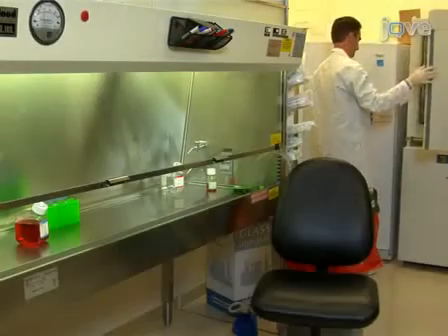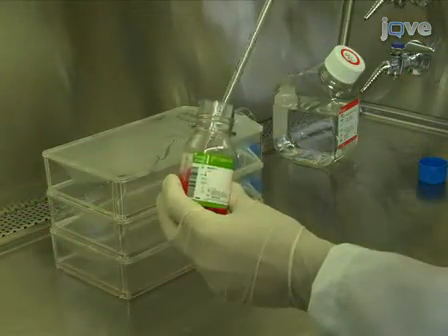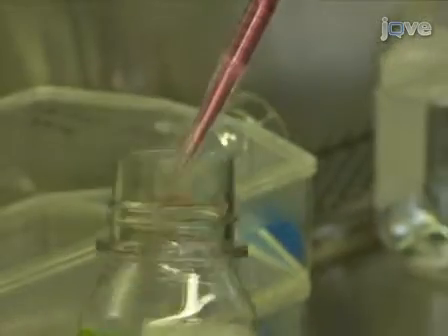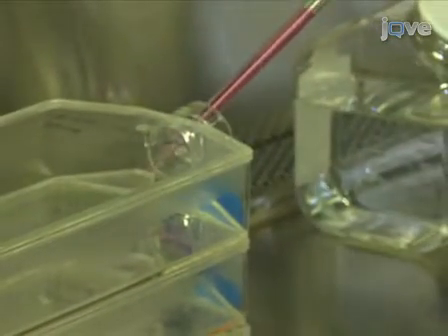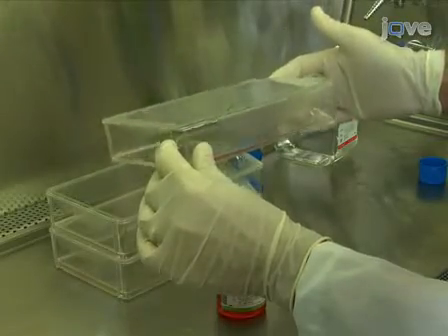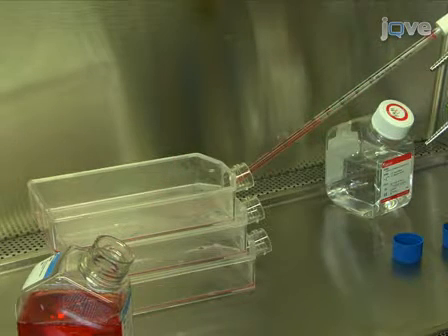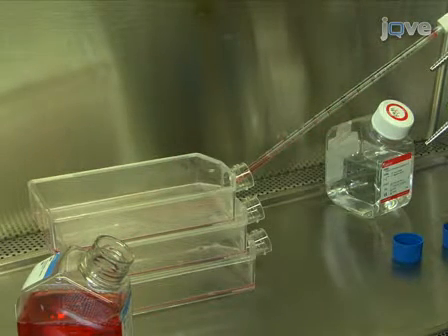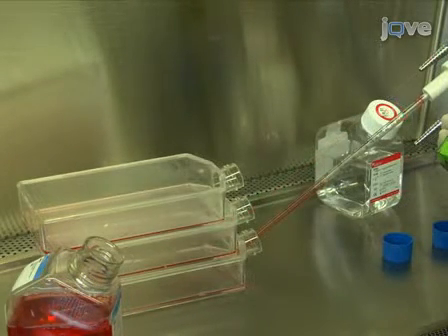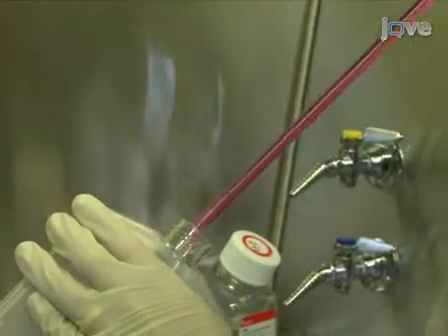The mouse embryonic fibroblasts, or MEFs, used in this protocol are adherent cells. So the first step in working with these cells is to lift them from the bottom of the flask using standard tissue culture protocols involving trypsinization. After the cells have detached from the flask, neutralize the trypsin with media containing serum, and collect the cells in 50 milliliter conical tubes.